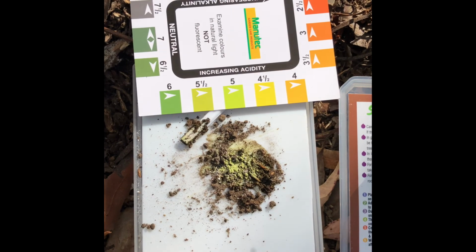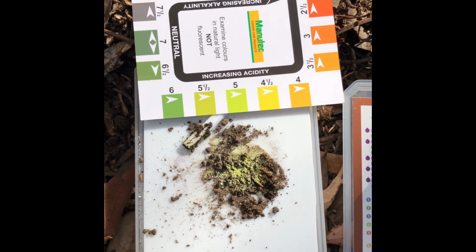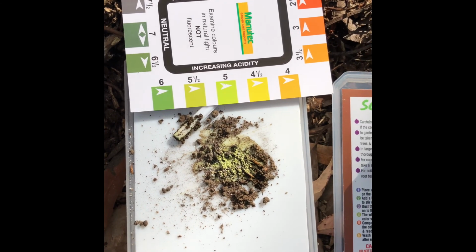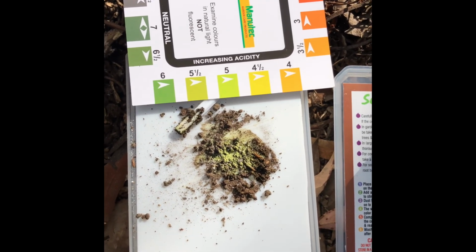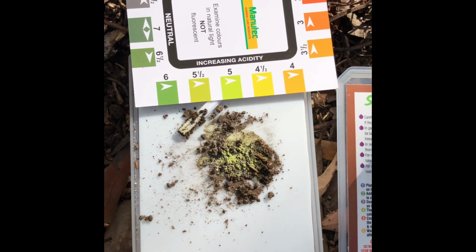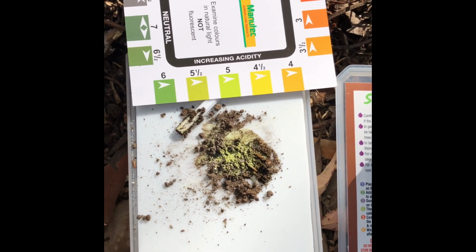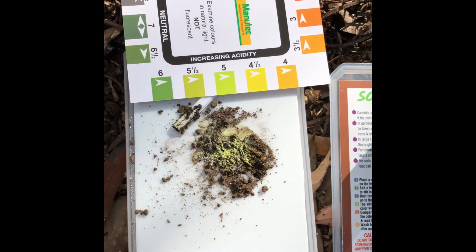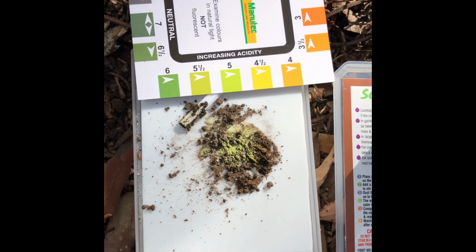Now for me, according to this chart, I would say that my pH is approximately between 5 and 5.5. So at the moment, by looking at the powder, and it may not come through the video that well, I would imagine that the pH of this soil in particular is probably around 5.5. That's the recording I would be putting in my field booklet if I did this soil pH test in the field.